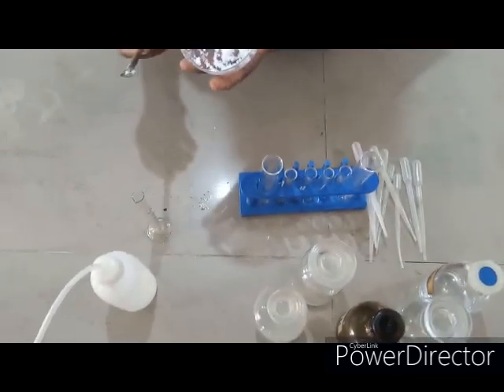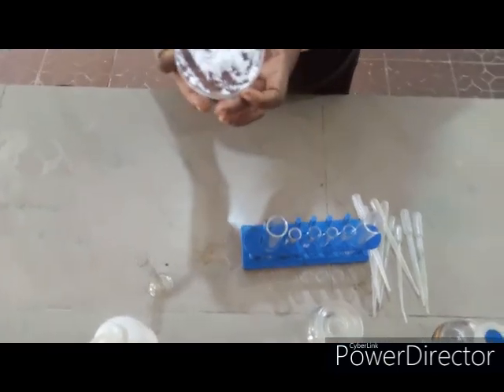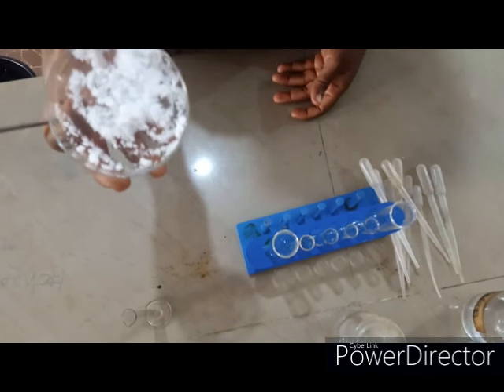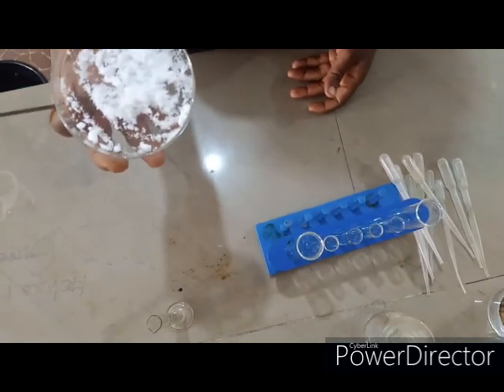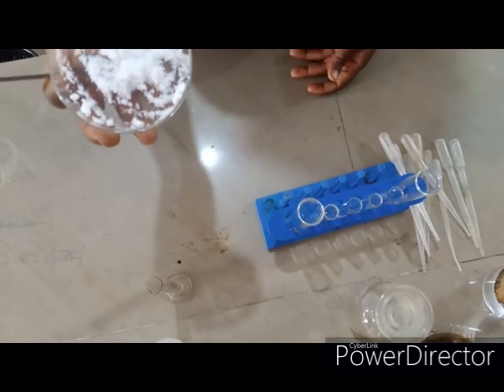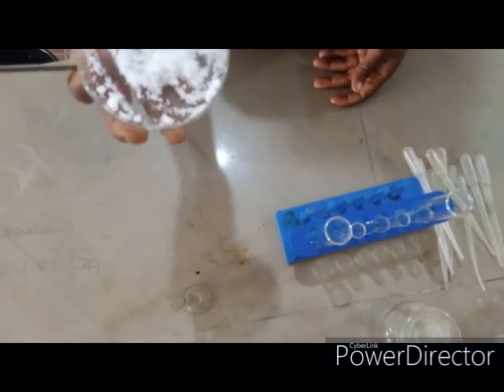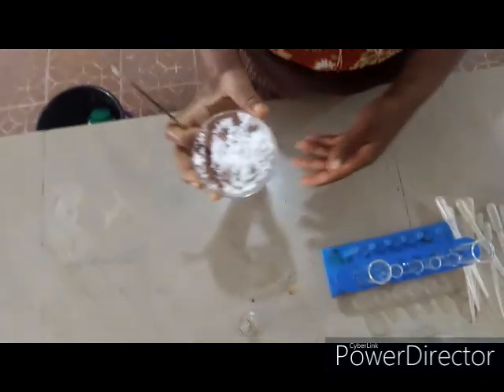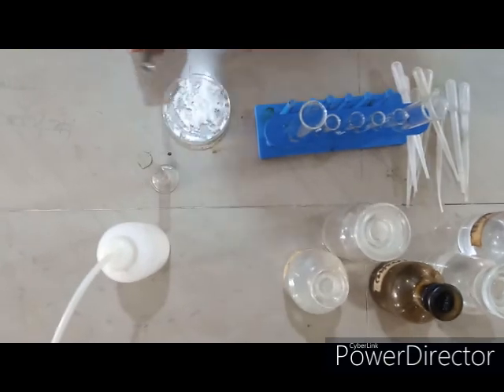Okay, let's start. Like I told you, the preliminary test, looking at the white salt, what cations can you infer even when you've not done the test? This salt can contain lead 2+, calcium 2+, zinc ion, or aluminium ion, because most of these 4 cations I mentioned, their compounds are white in color. But let's try to find out the particular one.